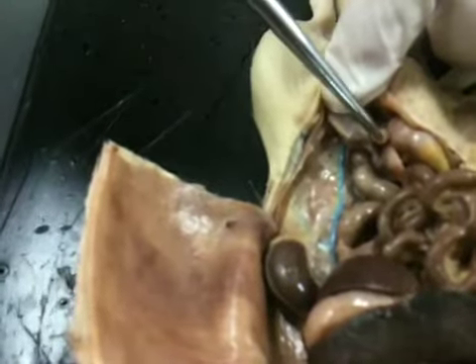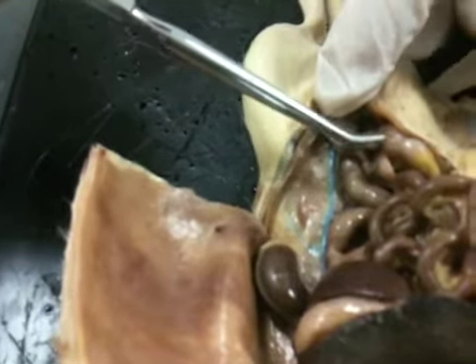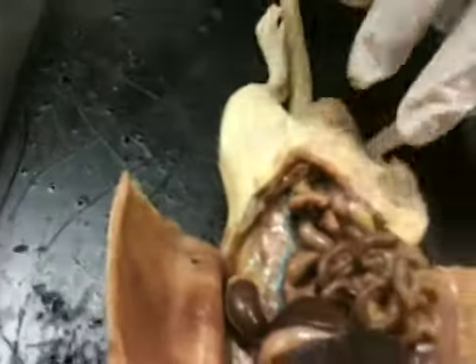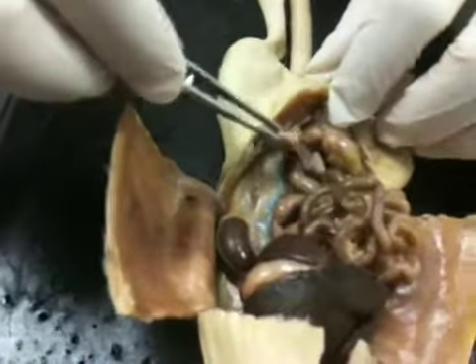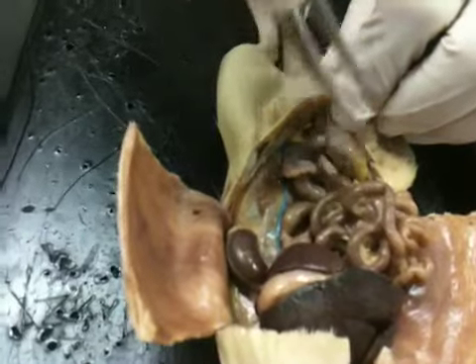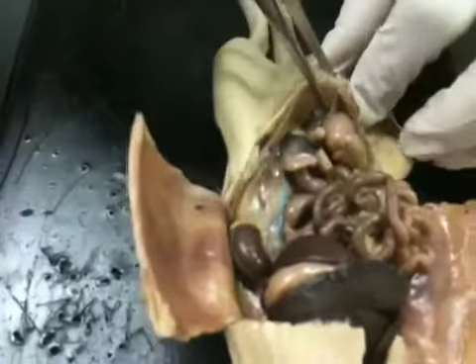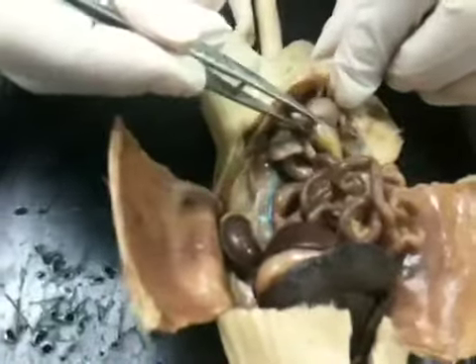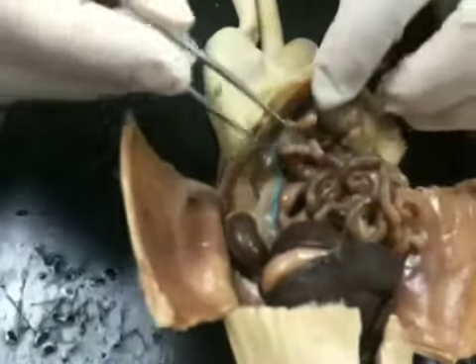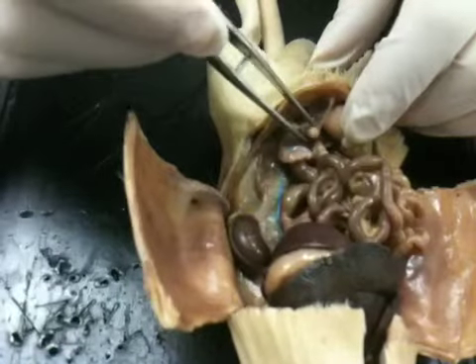Right here is the bladder. Not a very full bladder, so it's okay. And of course, this is a male, so we can see these bumpy wings. One here, right there. Those are the vesicular glands. That's what they're called in a rat. So vesicular glands right here. Oh, that's right. Here's the bladder.